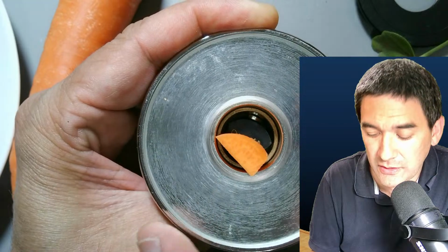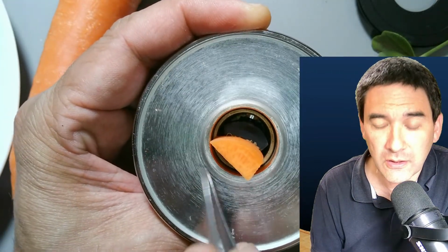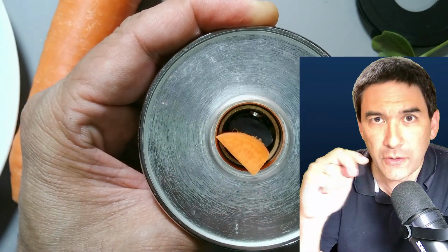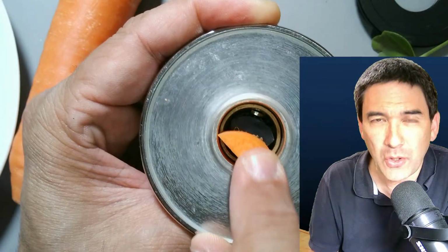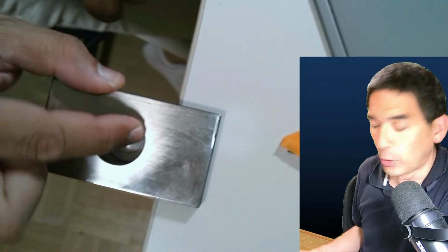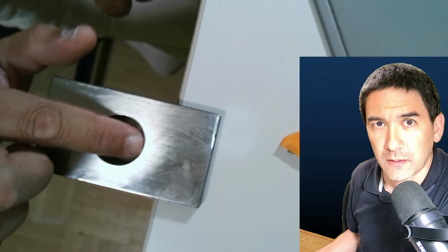So there is no support here on the side. So even if it were to fill out the inner part in here, it's still not quite touching the edge of the glass. So on the very top millimeter or two, there is no support. Okay, so this also adds a little bit of tolerance, and this is one of the reasons why I like this one over here a lot, because you see the support goes all the way to the top. So the carrot will actually touch the rim over here as well.